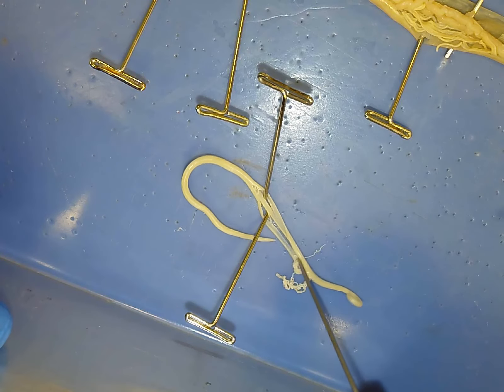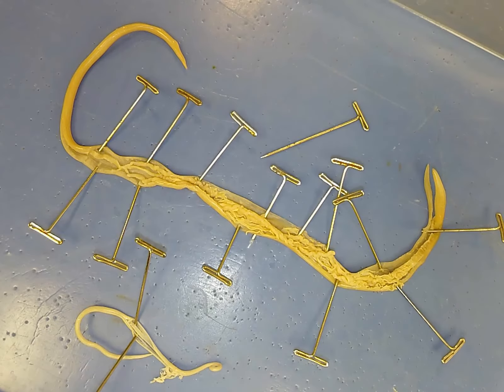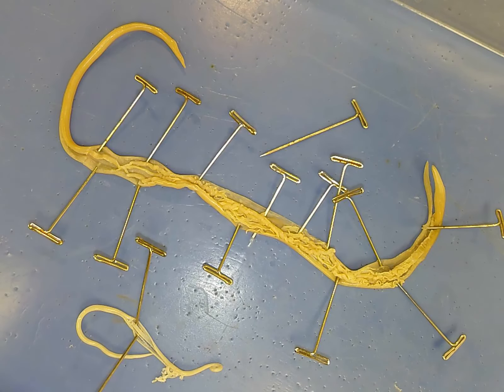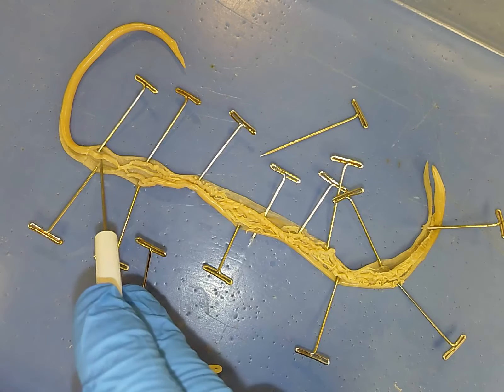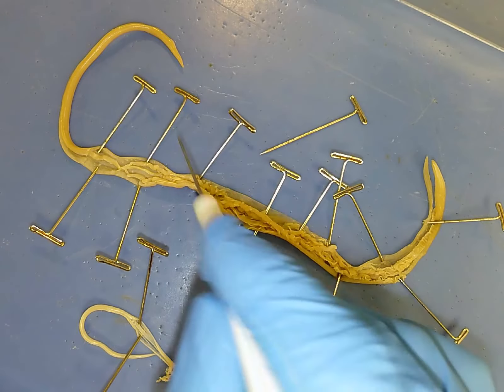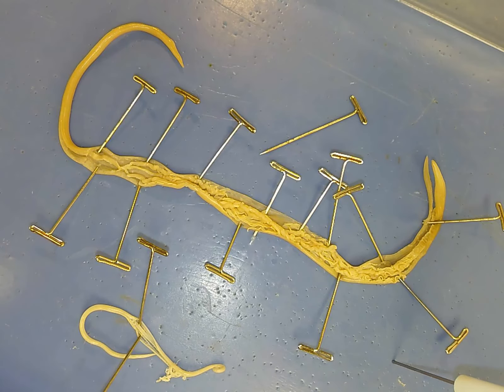Males are much more simple in terms of anatomy — basically a reproductive tract with a digestive system attached. These organisms are essentially just passing on their genetic material by fertilizing the female and don't serve much other purpose. So that's a nematode dissection — a very rough one — but you do get the idea of the simplicity of these parasitic organisms as well as the anatomy of a female. Remember: females have two uteruses that converge at a single point, and from there eggs flow out of the body through the genital pore. They have an intestinal system, an excretory system with an excretory duct. They do have a nervous system but the nerves are much too small to see with the naked eye. That is Ascaris lumbricoides, or the human roundworm, in about 15 minutes.